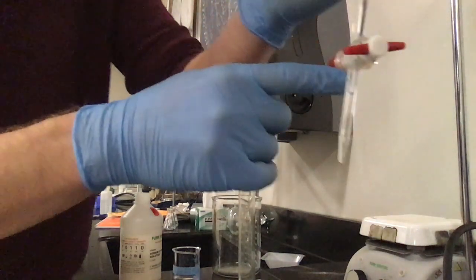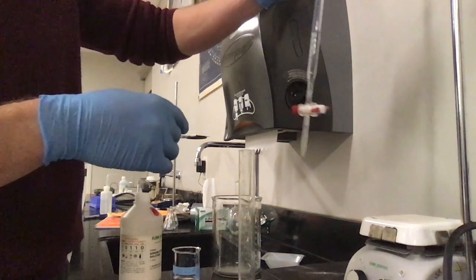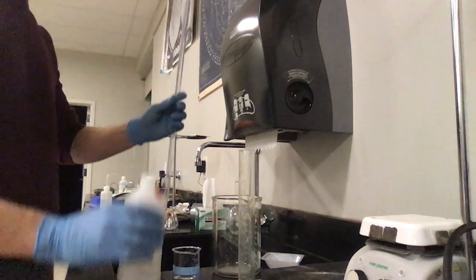Okay. I have a little bubble there, but we'll talk about that in our post lab. So it looks like this is pretty good. I'm going to fill it all the way up to that zero mark.